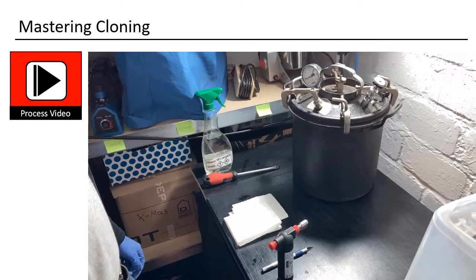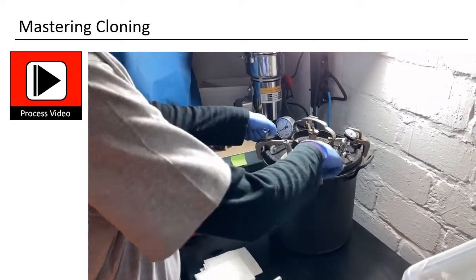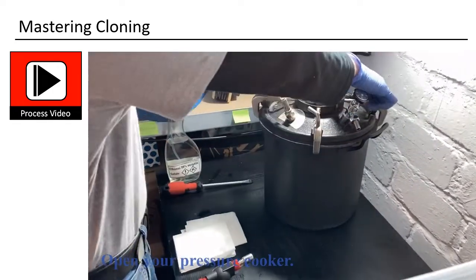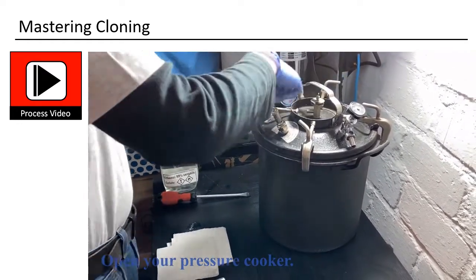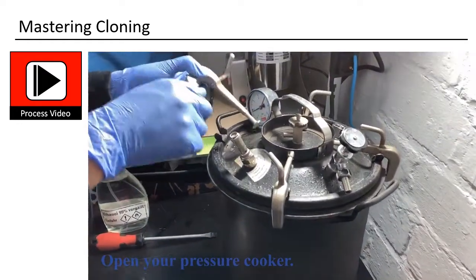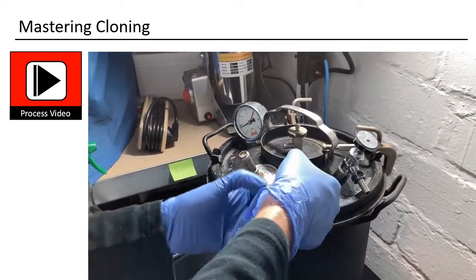Now we will see the process performed. In this video I will show you how to perform the inoculation. Always spray your hands and work as sterile as possible. There are other builds for the still air chamber, but mine works great — no need to overcomplicate the process.